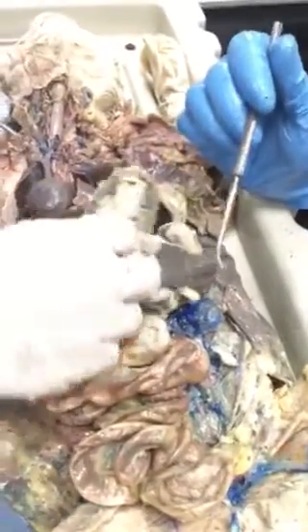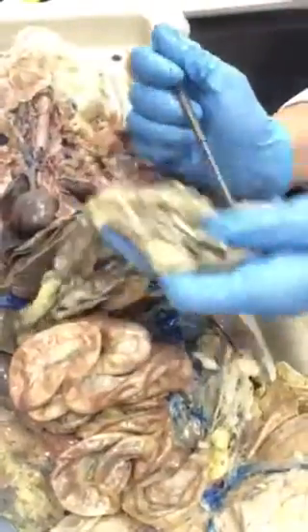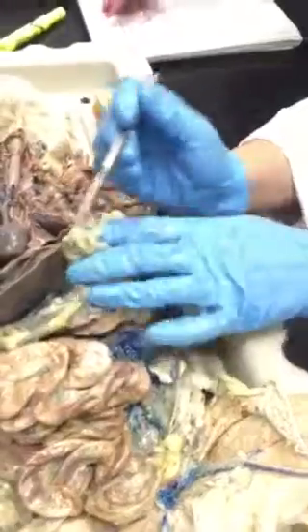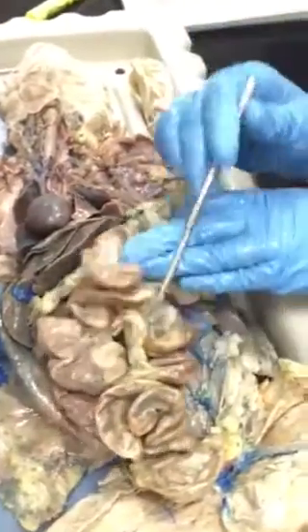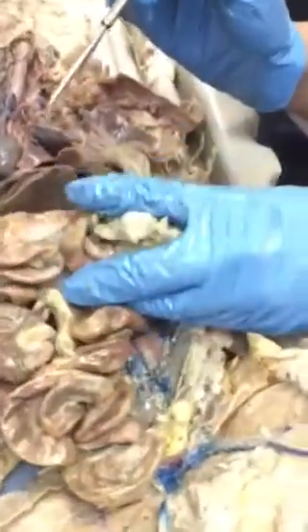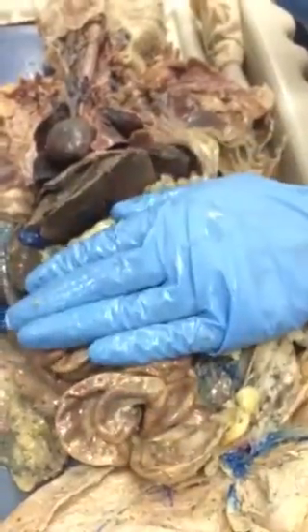You don't have to know this. It's just general knowledge that this is what we would call omentum, and it's very similar in function to the mesentery. It's all the same kind of tissue, just in different locations. What it does is help to cushion and pack organs, because it's mostly areolar connective tissue plus some fat.